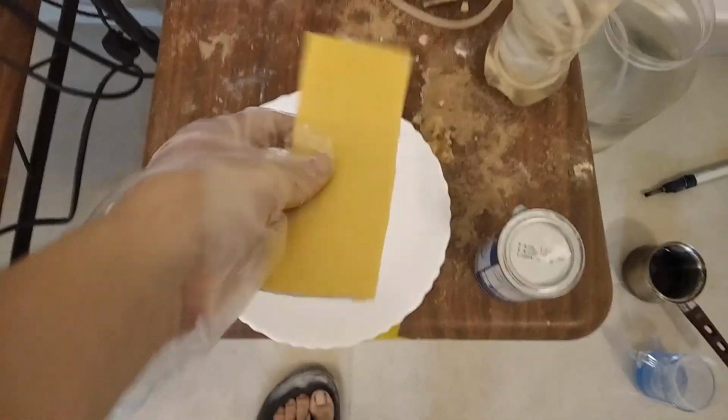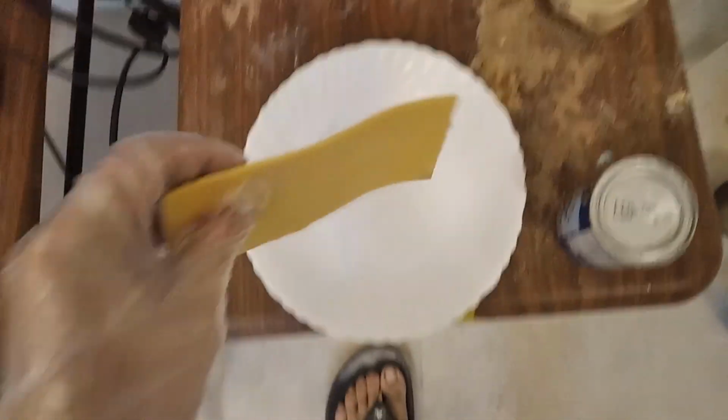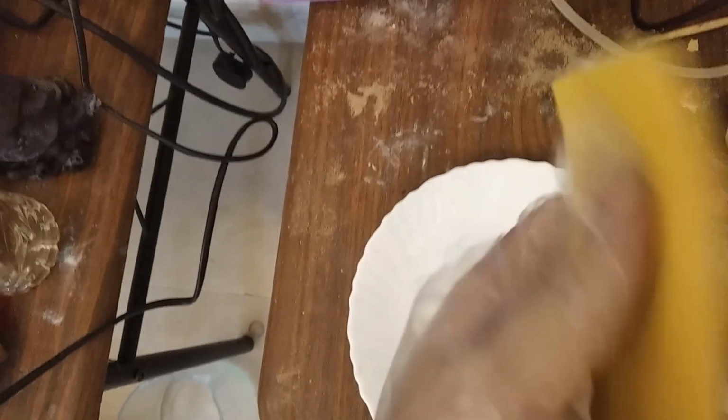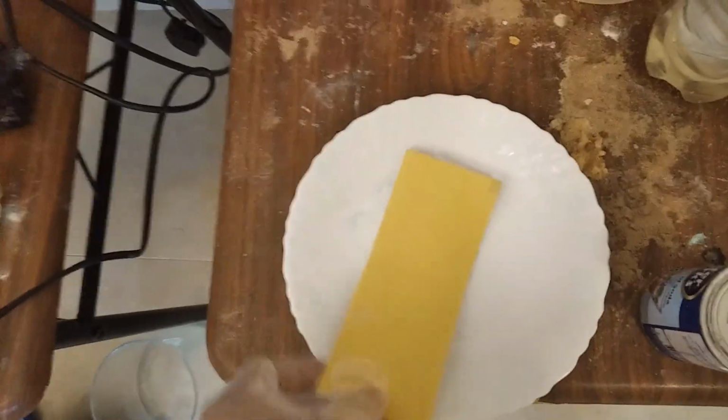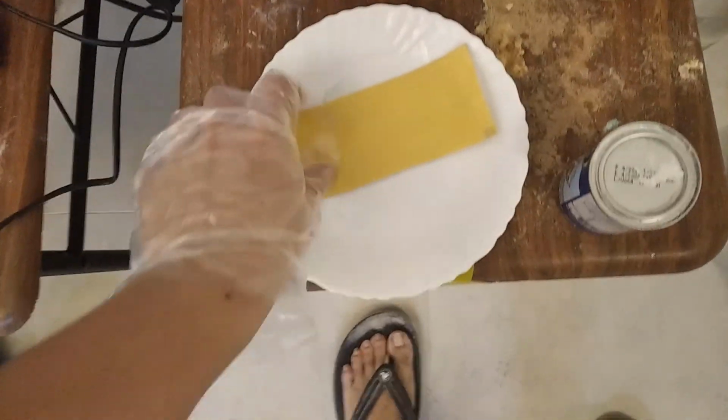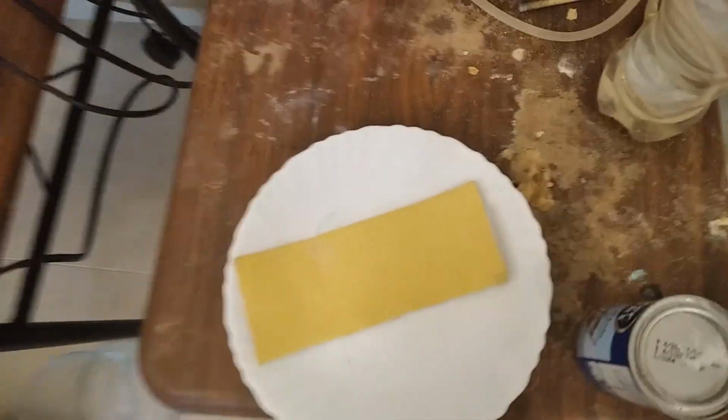This is a membrane. It is fully dry as a brick. But as you can see, the polymer membrane is inside this support structure. And now you can glue this without any worry using hot glue. Once you bend it, the walls like this and like this, you can put it in any container.